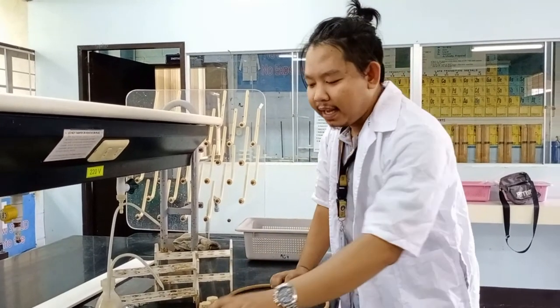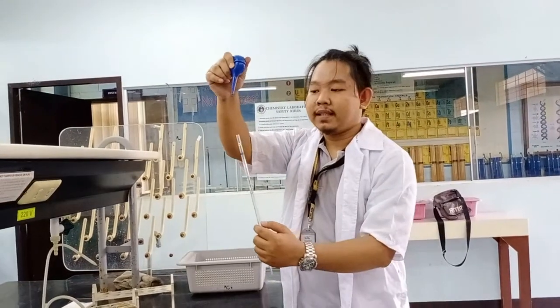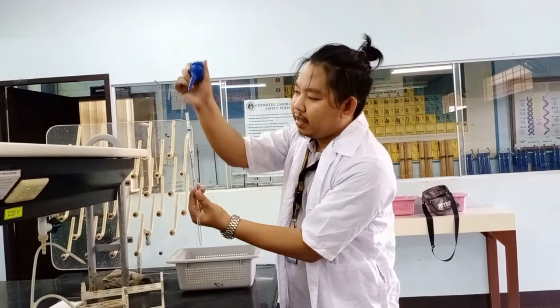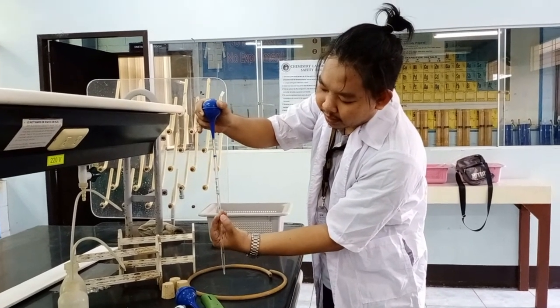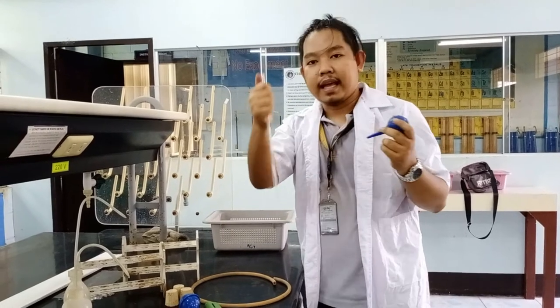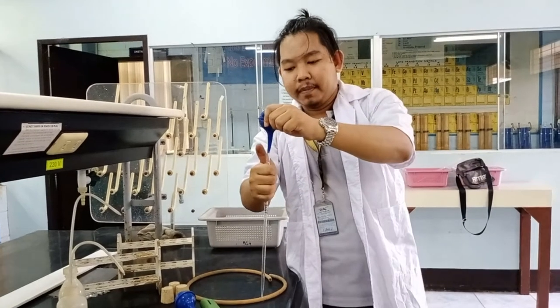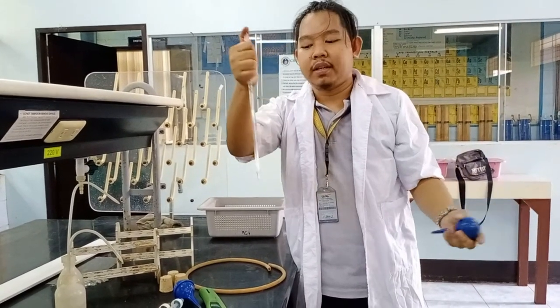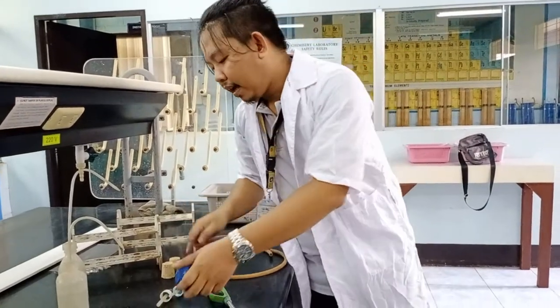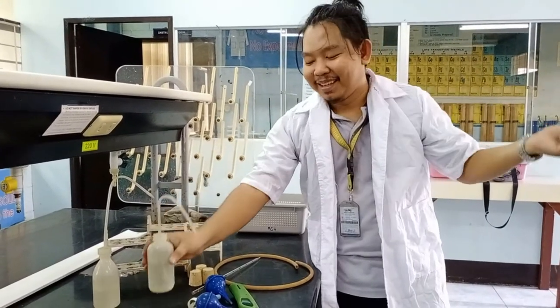Again, I prepared the separating funnel. And this is your aspirator — this is what we attach to the pipette. When you use it, you press the aspirator depending on the liquid you want to draw, then dip the pipette into the liquid and slowly release until the liquid rises into the pipette. The proper way of holding it: your thumb goes here, aspirator pressed, place it, dip it, release — once the liquid reaches the desired level, apply pressure so it stops dripping.